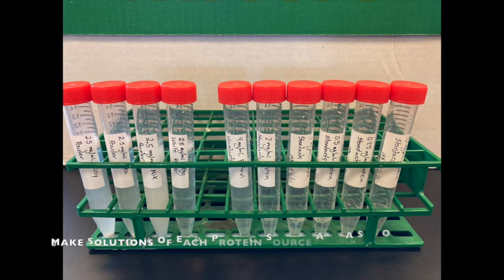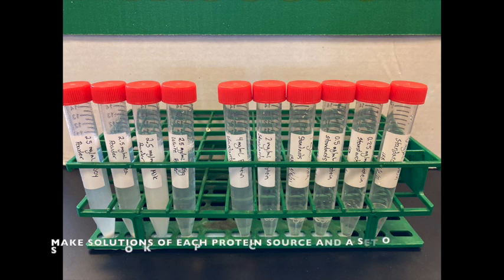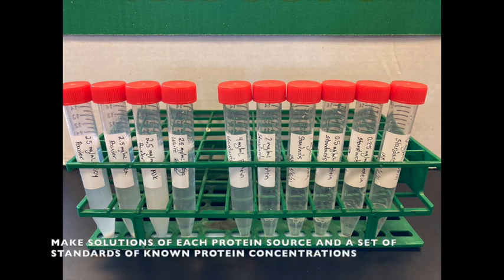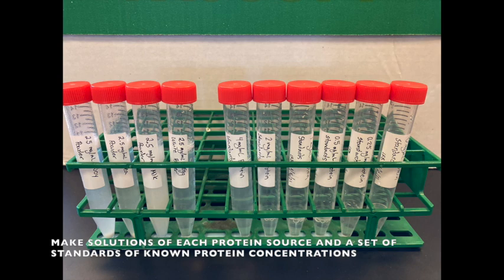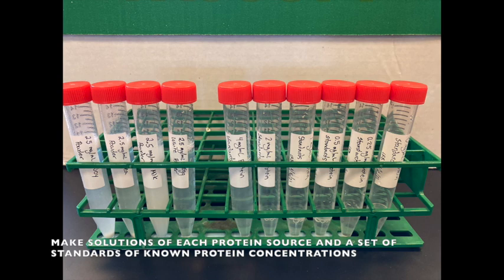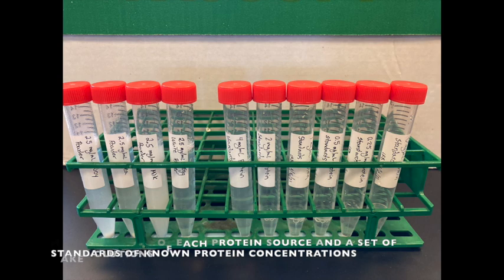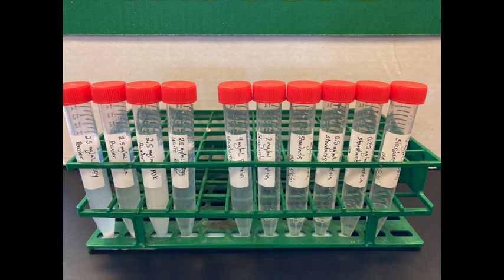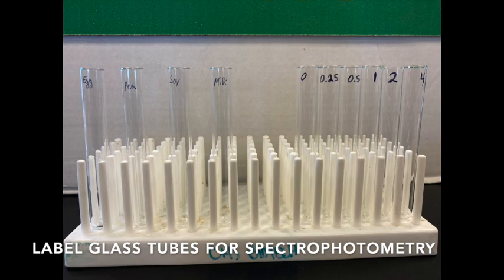In this image, the four tubes on the left in the rack are our four different protein sources that we are analyzing: milk powder, egg powder, pea powder, and soy powder. The tubes on the right are solutions of known concentrations of protein. I weighed them out so I know exactly the concentration of protein for each of these standards on the right. We will compare each of these solutions in the spectrophotometer.